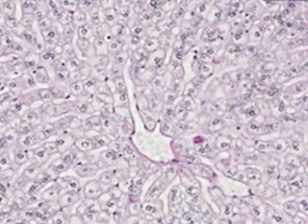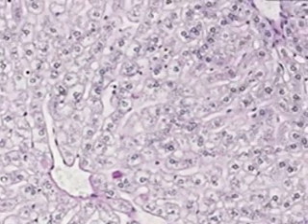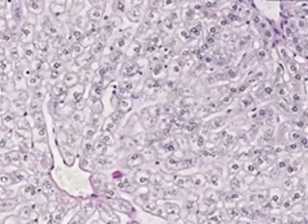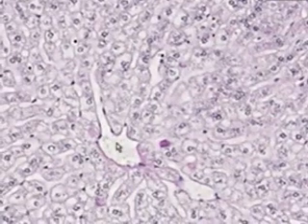So I can promise you, whereas every single round nuclei here is a hepatocyte, if you see something a little spindly, like here, or here, or here, or here, these are going to be the macrophages of the liver, which are called Kupffer cells. And really, except for the portal veins and central veins, everything in the liver is either a Kupffer cell or a hepatocyte. Everything in the central vein is nothing more than an endothelial-lined vascular surface.